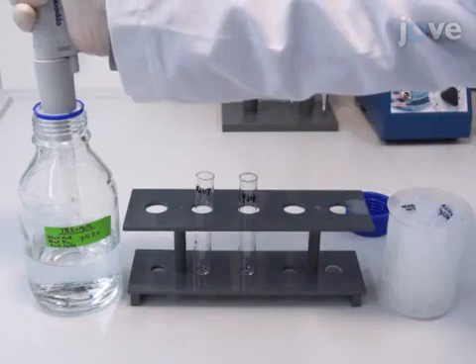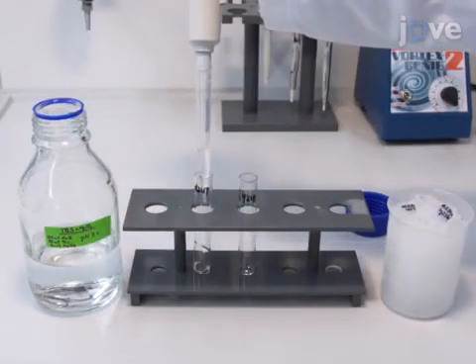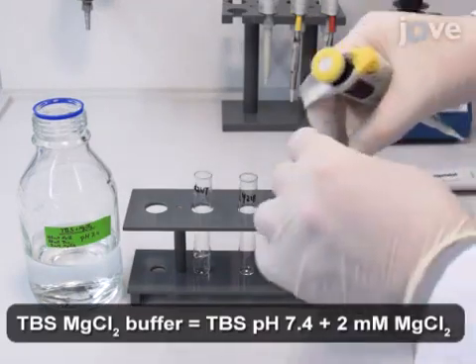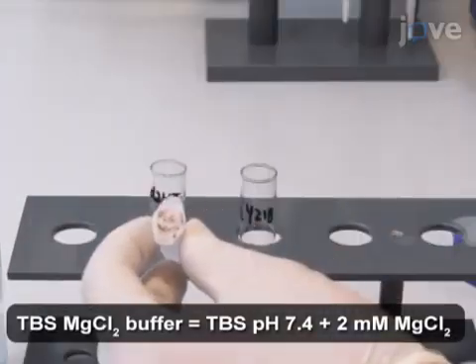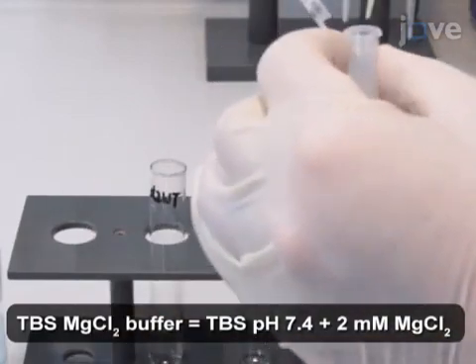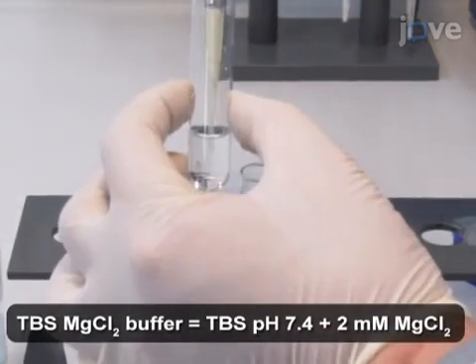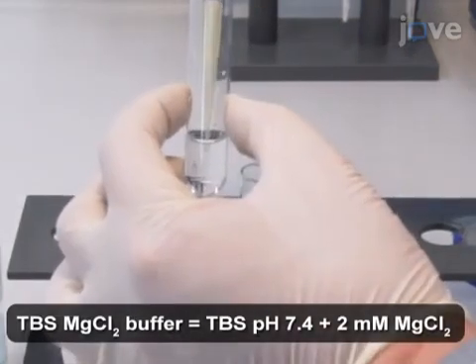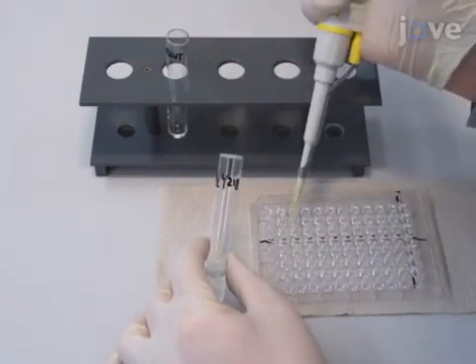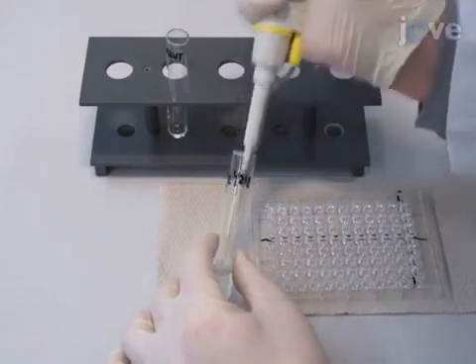Begin this procedure by diluting the stock solution of integrin alpha2a domain to a final concentration of 5 micrograms per milliliter in TBS magnesium chloride buffer. Fill each well of a row on a half-area microtiter plate with 50 microliters of the integrin alpha2a domain coating solution.